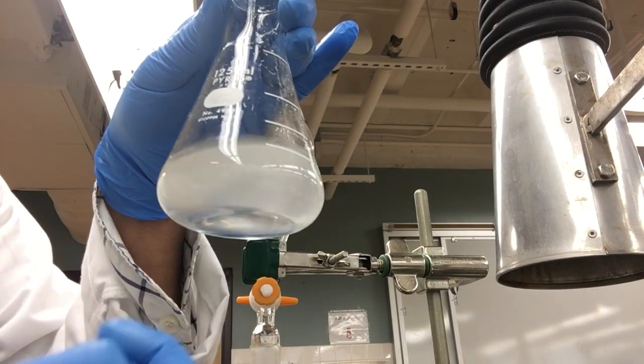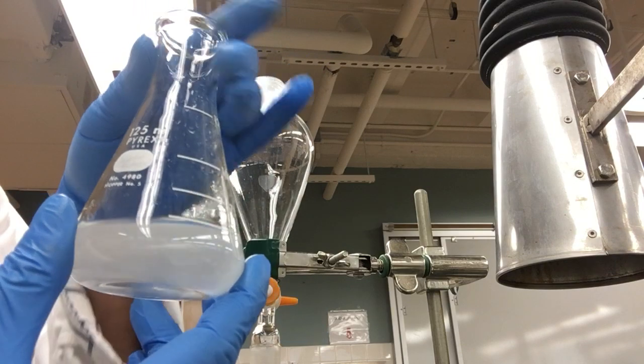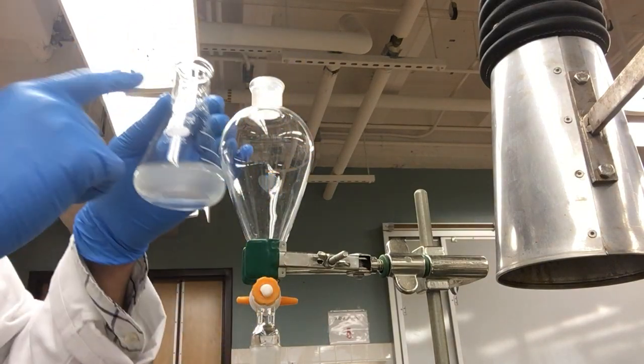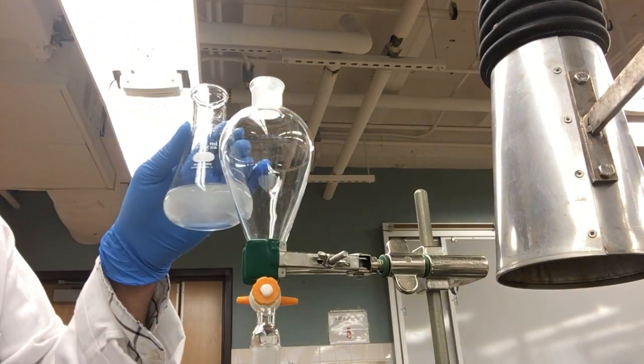All the salt dissolved, so there is no undissolved salt, but if there was any undissolved salt we would be careful that we do not add that salt inside the separatory funnel.